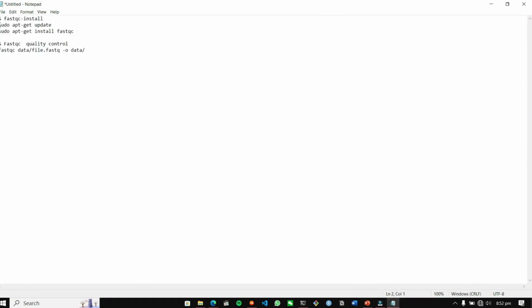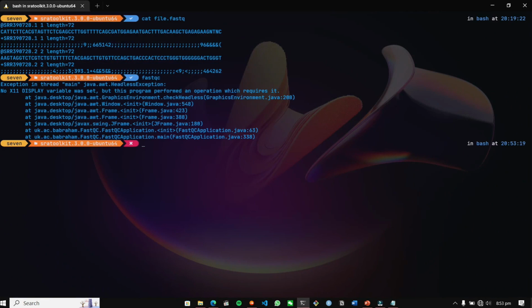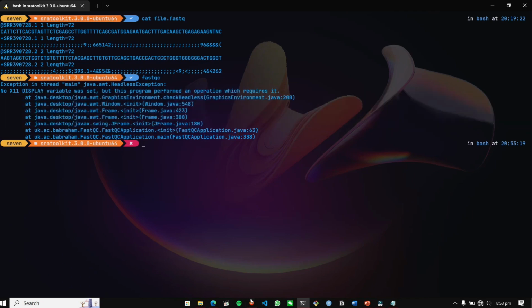Moving on to our text file, I'm going to paste it here. sudo apt-get update, I'm going to update my system, and then I'm going to install with sudo apt-get install fastqc. So that is it for installing our FastQC tool. Now that it has been installed, we need some file for the data analysis, which we already have, file.fastq. Let me check FastQC. Yep, it is installed. It requires some Java files.